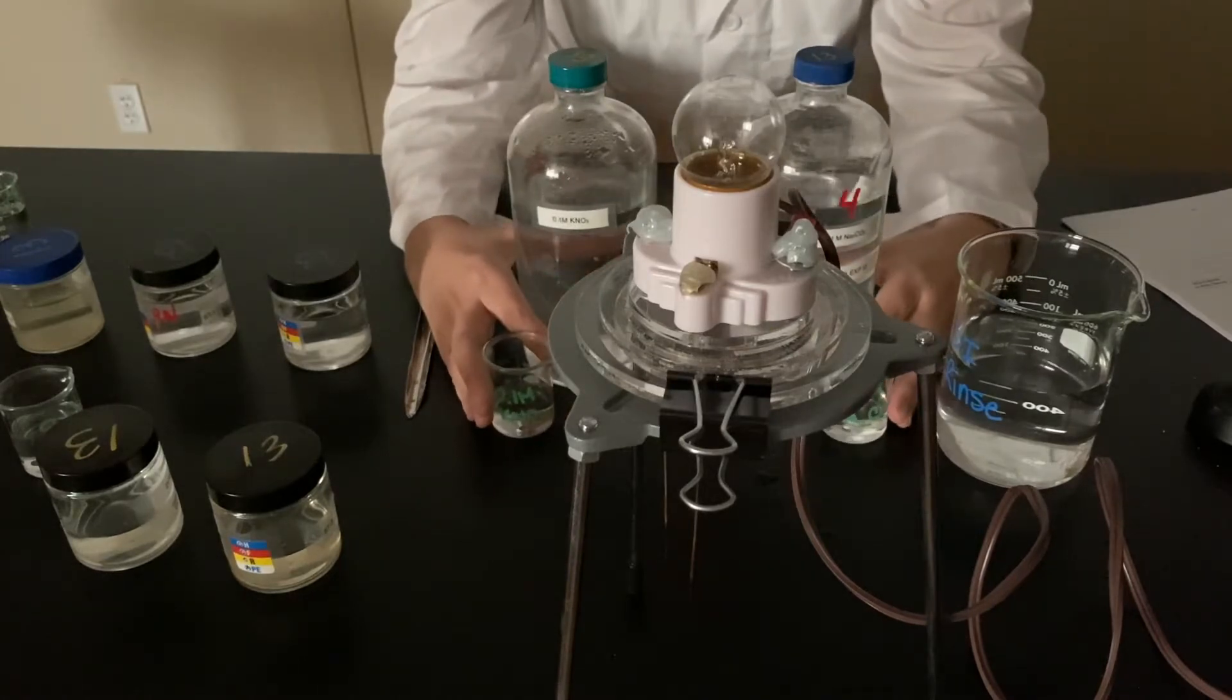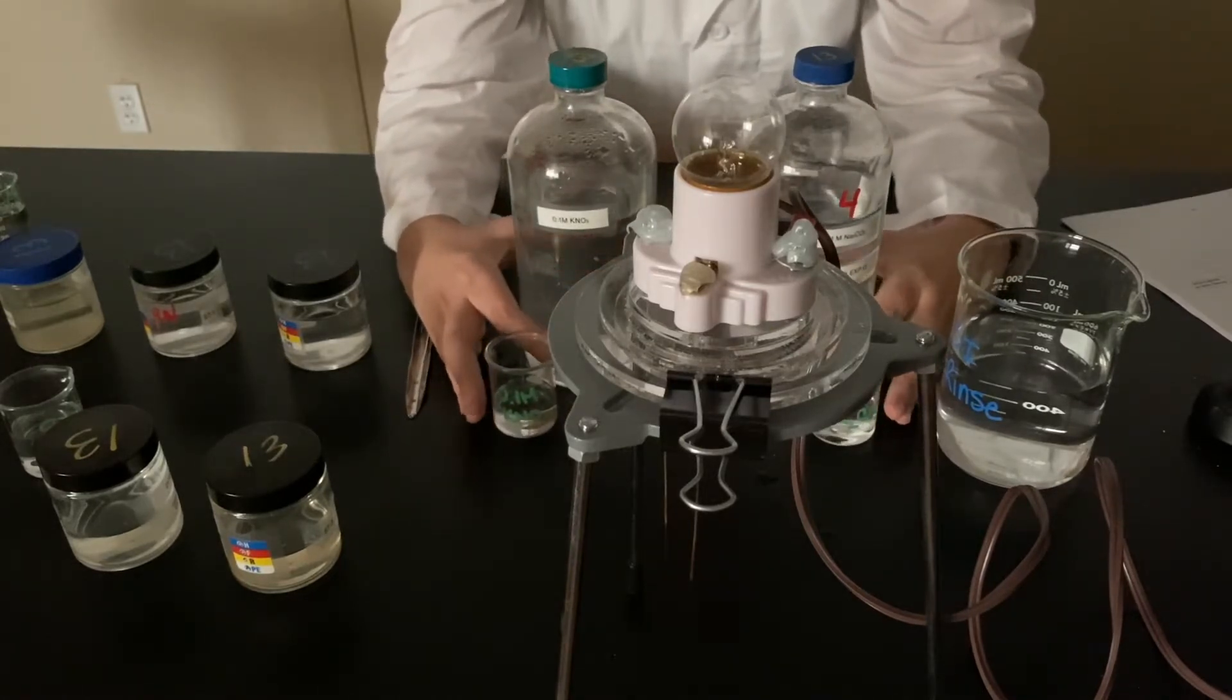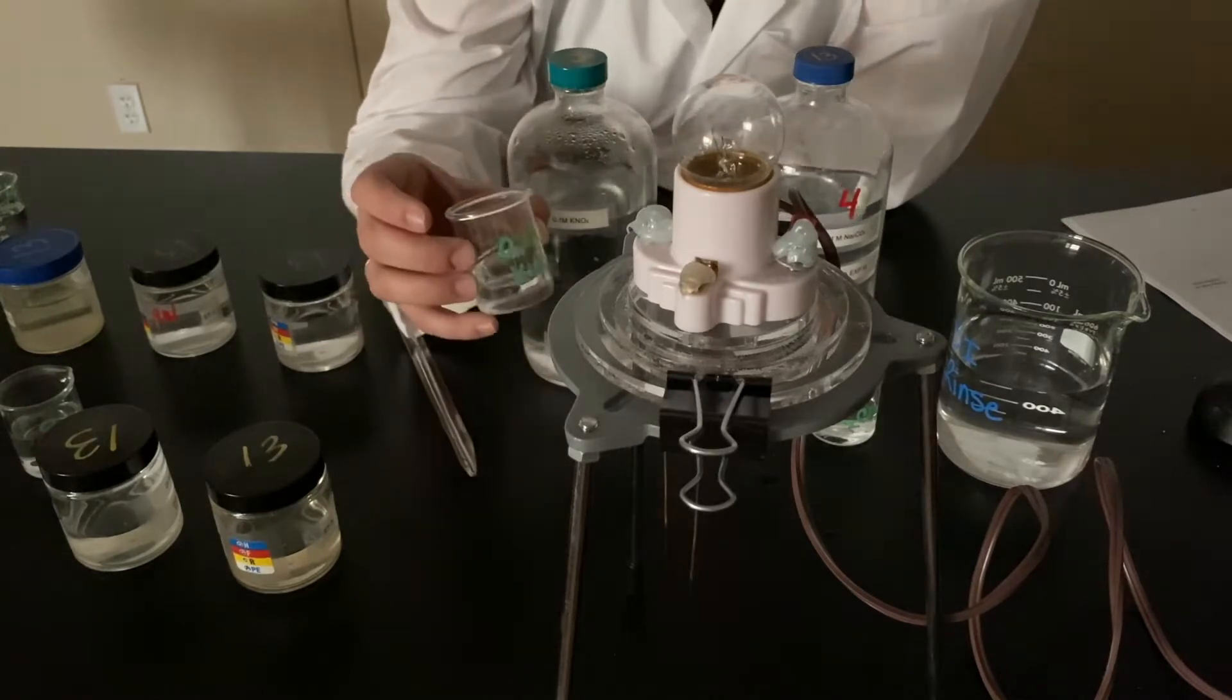We're going to test each reactant individually first. So this is my potassium nitrate.